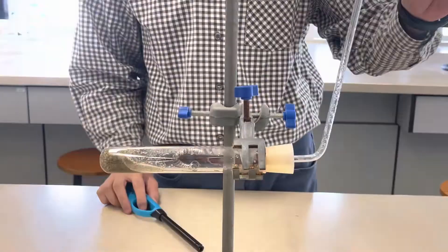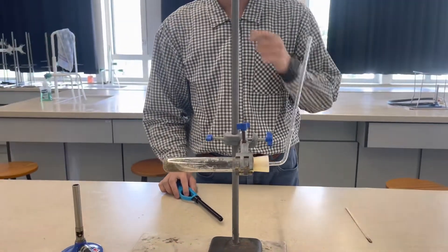And the gas, I am going to use a burning splint to light up a flame so that you will see what kind of gas it is.